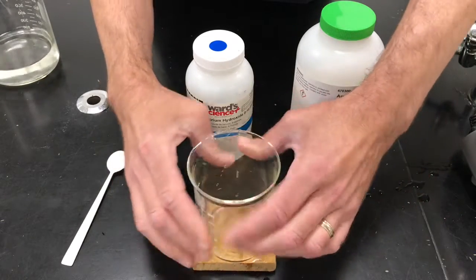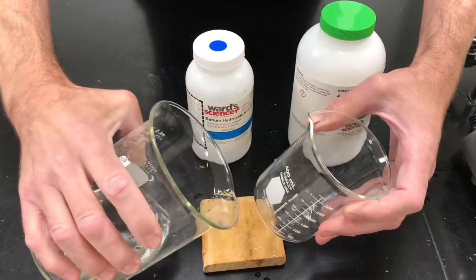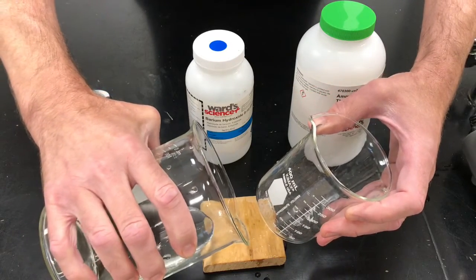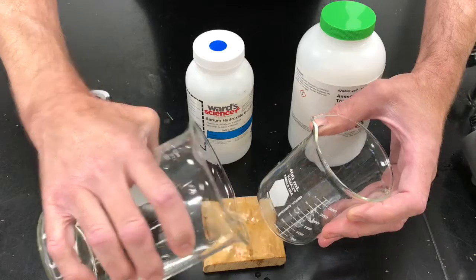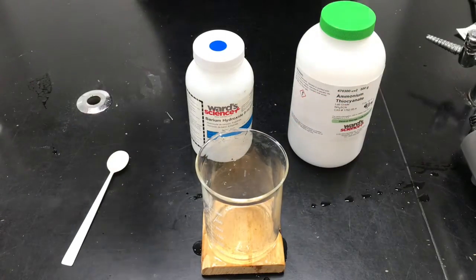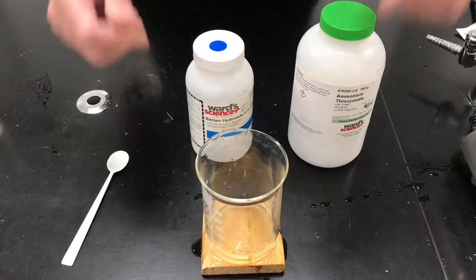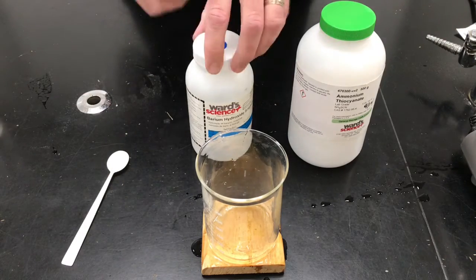Now there's no water in the beaker. Matter of fact, I might want just a little bit more in there. So let's see. It'll make it a little messy. It's all right. So we're getting a little water in there. Awesome. Then I got water under the beaker, between the beaker and the wood. There's no water in the beaker. So you have to be clear with that.